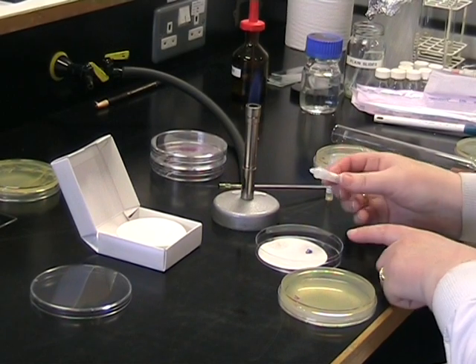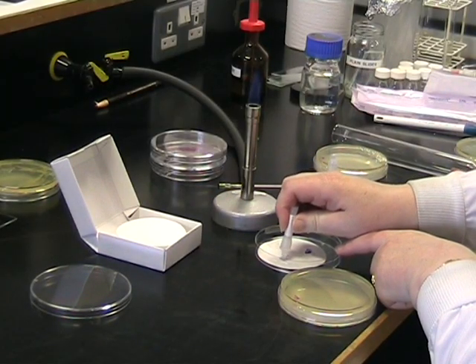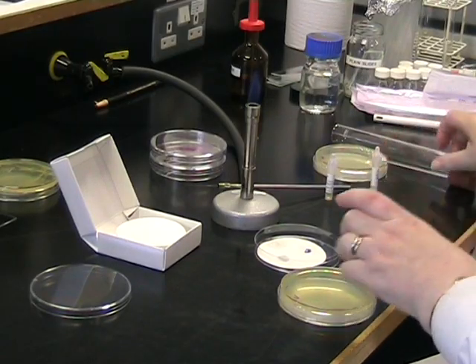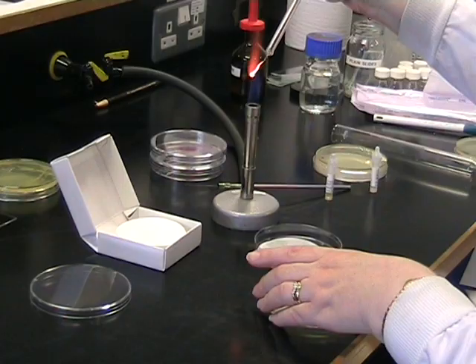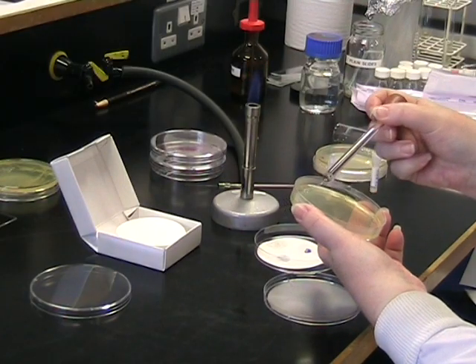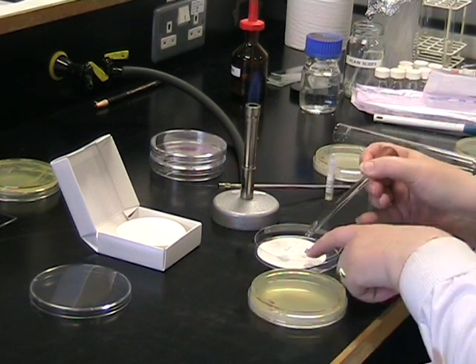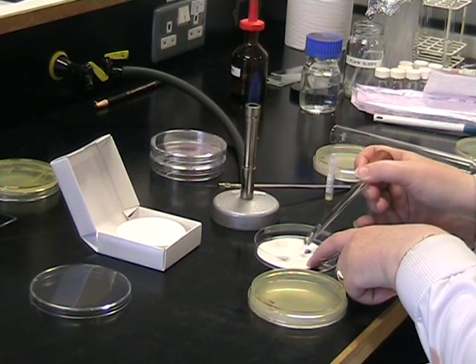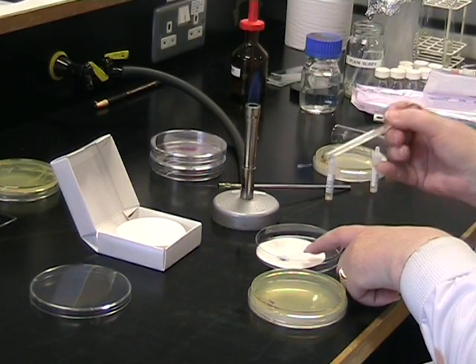We're now going to test our unknown organism to see if we get a positive or negative result. As before, place a drop of reagent onto your filter paper. Take a sample of your unknown organism and rub onto the reagent on the filter paper. Note that in this case there is the formation of a blue colour.